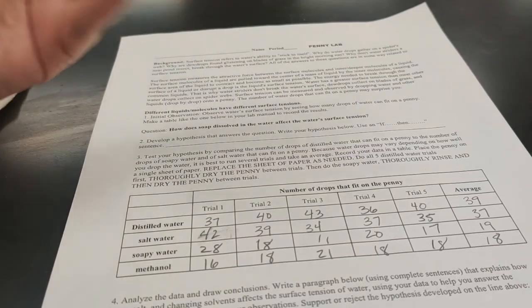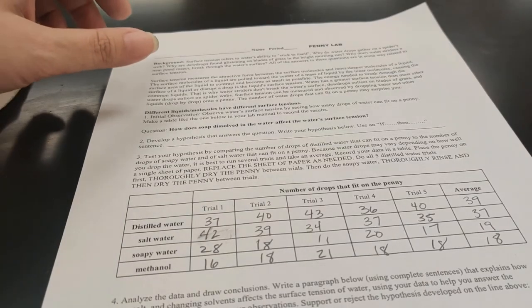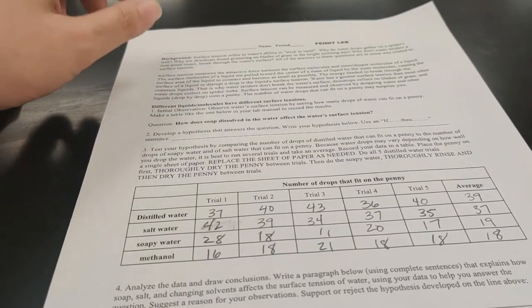So we can see that some substances clearly do have a higher surface tension than others. And maybe we can use some of the information we get in the notes on this unit to help us figure out a good conclusion here about how we can affect the surface tension of water. Some substances clearly have a negative effect on it. Others are clearly fairly neutral. So let's take a look at that as we look at our notes over the next day or so and see where we're at.